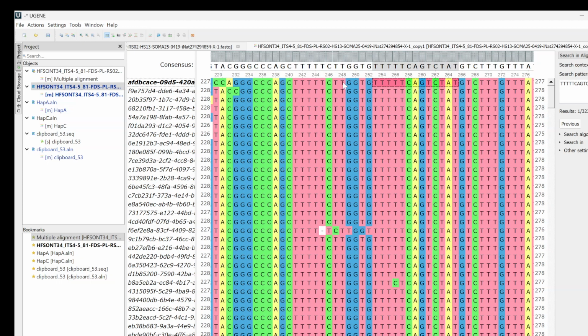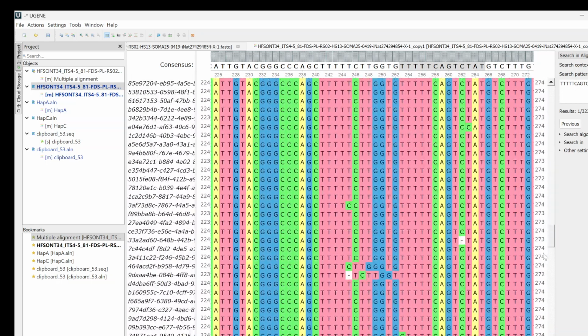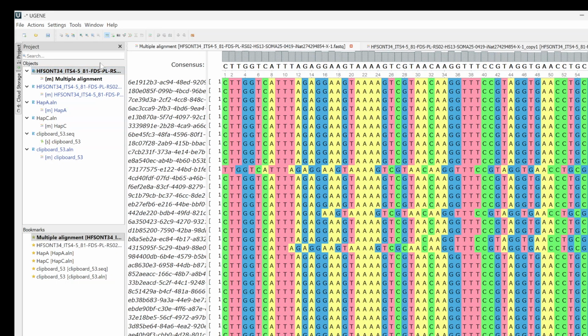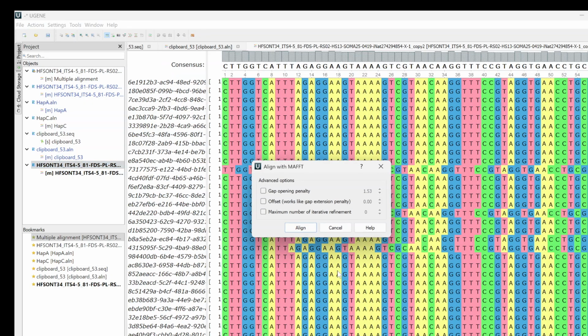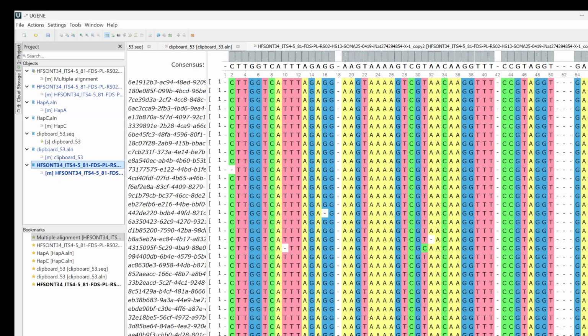And so this is the region where things are funky. Oh, that's right. Our main alignment is just one of the haplotypes. Let's make a fresh export. Align it. Hopefully you can tell I don't use UGENE quite that much, but it is really good considering it's free.